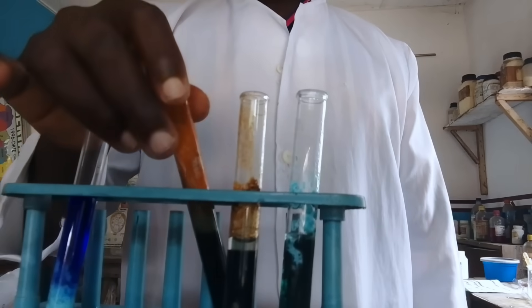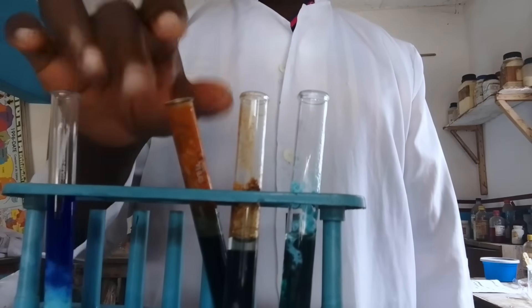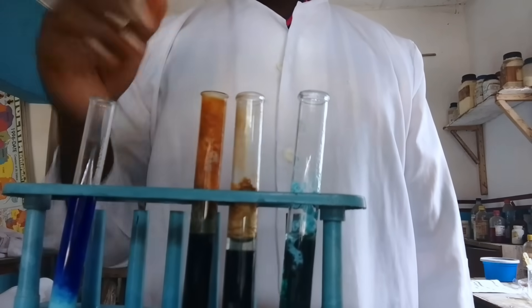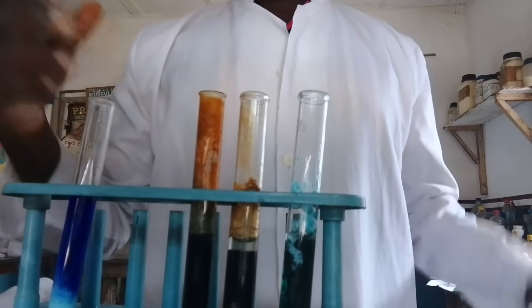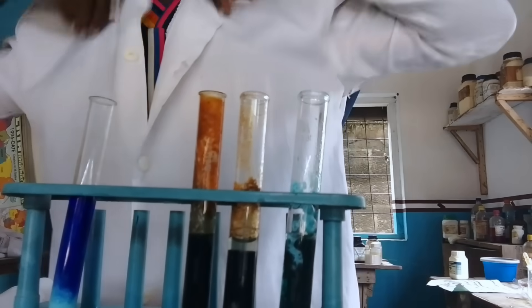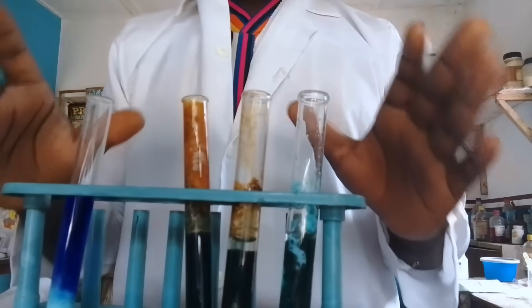A green precipitate is formed. Then when you properly shake it, it turns brown. So the observation is: green precipitate that turns brown on shaking.